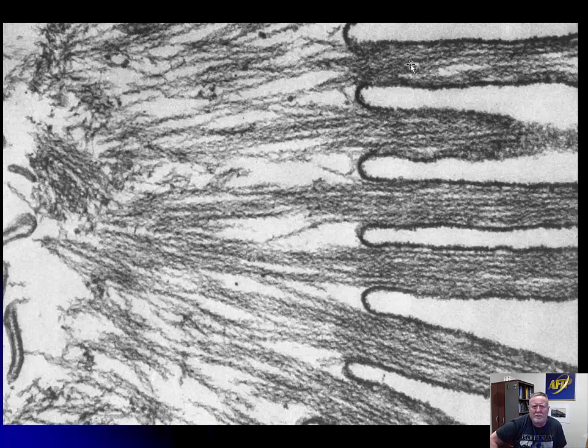It's not something that you really talk about much. It's not something that you would describe because it's one of the smallest things. You almost never get close enough, and really there aren't a lot of pathologic conditions which are associated with problems with actin polymerization. In cells, especially cells that are motile, it's about 15% of the total protein of the cell, which tells you how much is actually in the cell. So actin filaments and myosin. Microvilli, so we know that we're dealing with an epithelial cell.